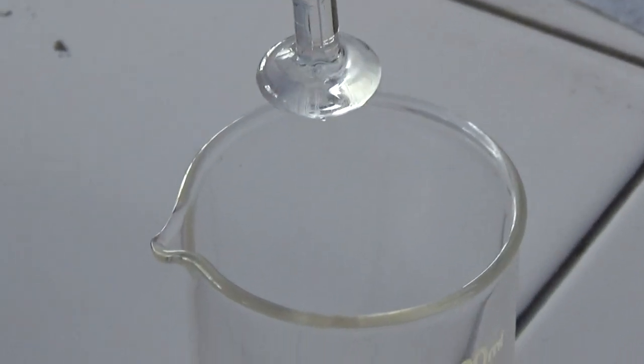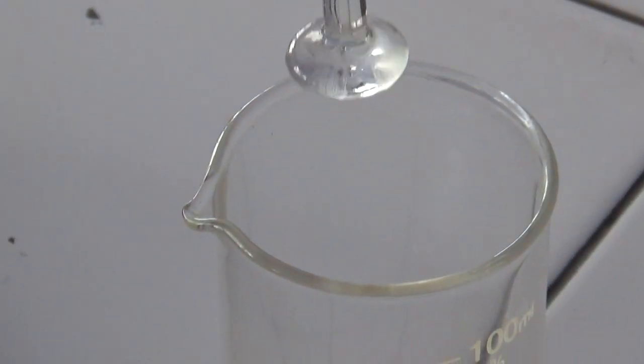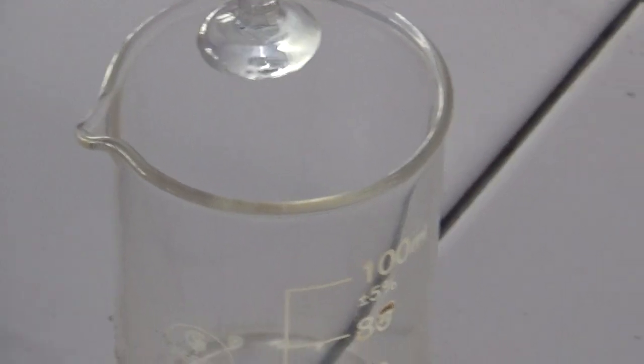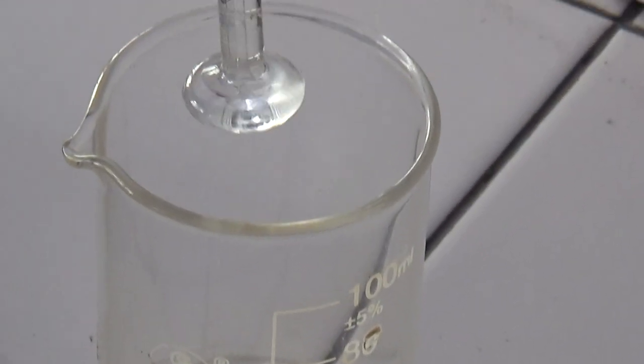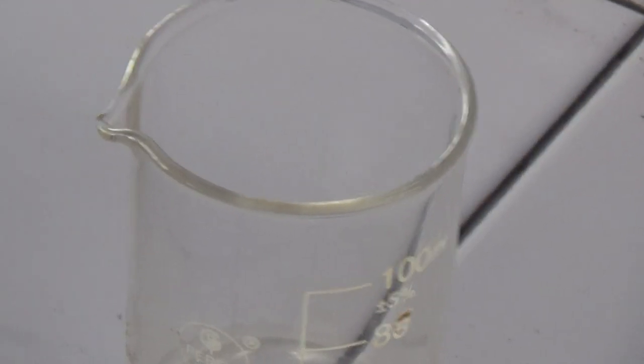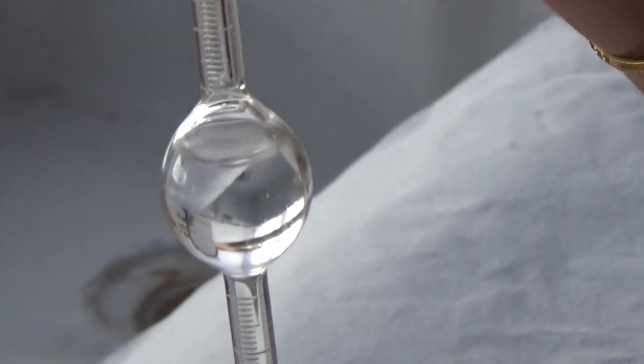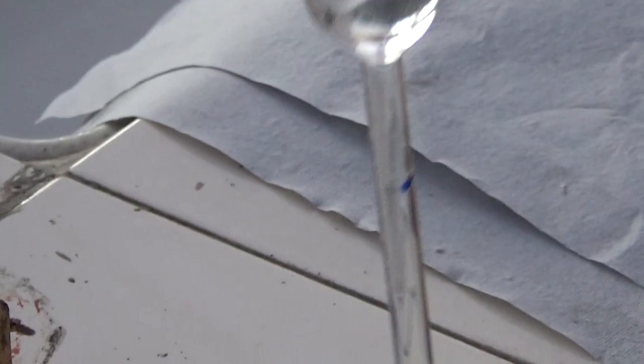You have to count the drops. Like similarly, this number of counting of drops will be three times for water — 3 times for water.